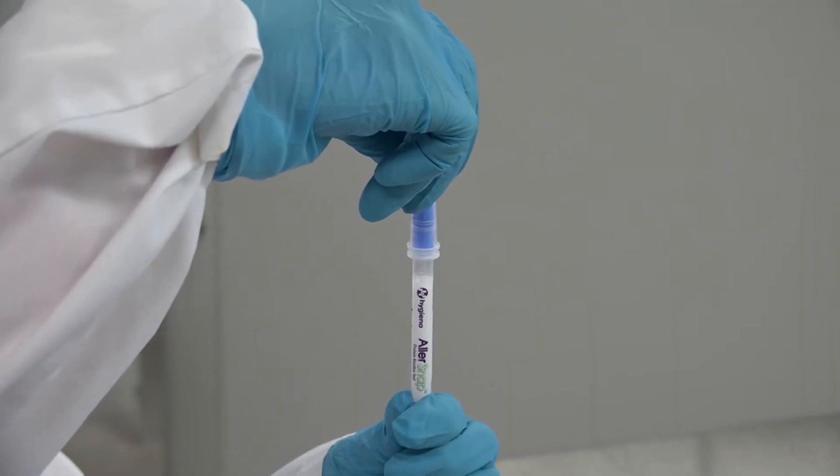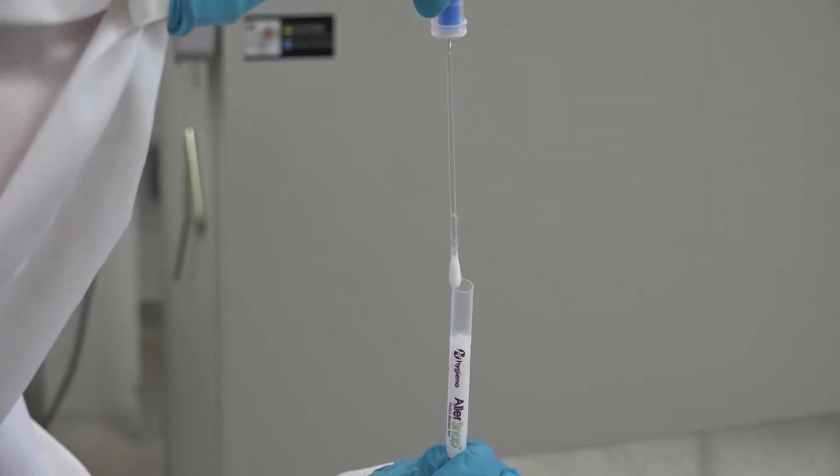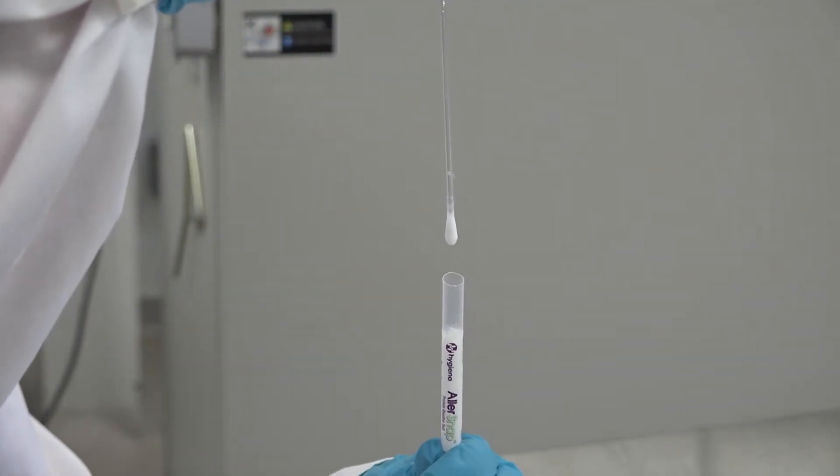Step number three, remove the swab from the tube. Be careful not to touch the shaft of the swab.